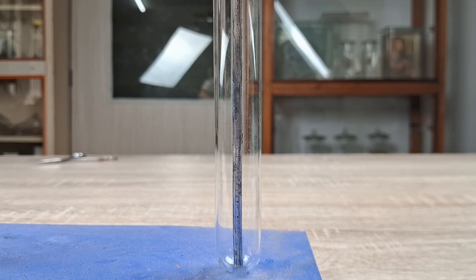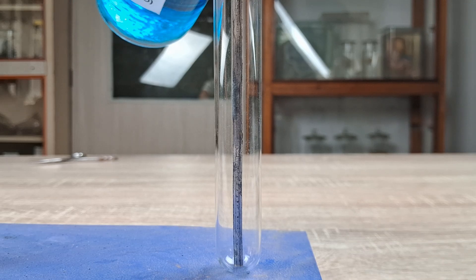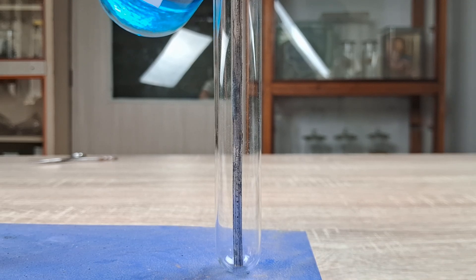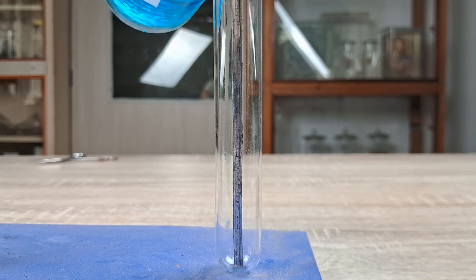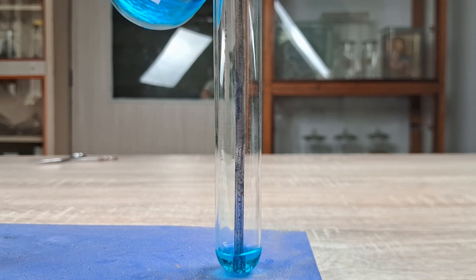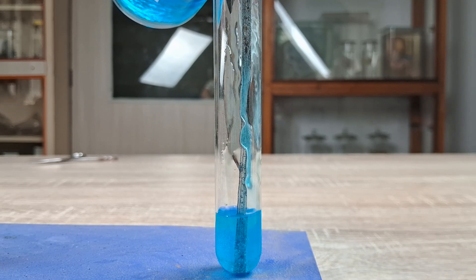First, take the magnesium metal ribbon and place it into the test tube. Add copper sulfate solution to the test tube to completely immerse the magnesium.